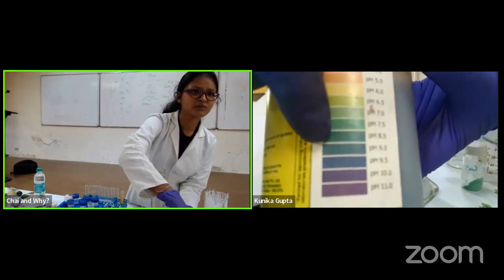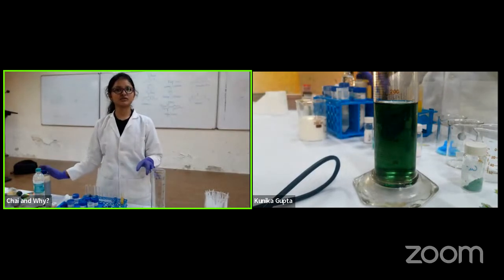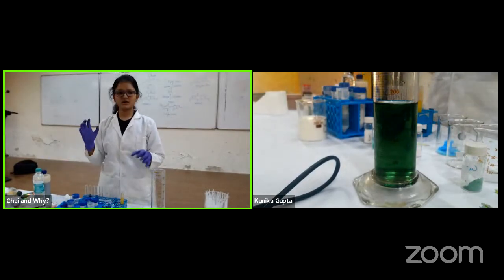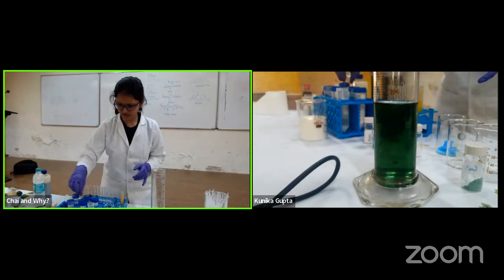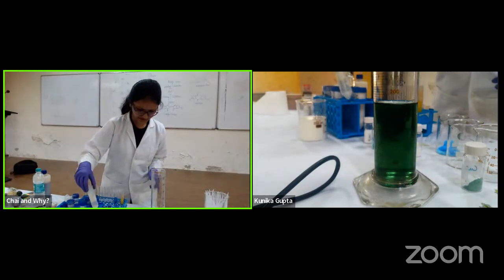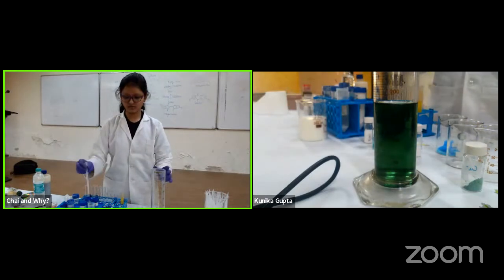Okay, in this range. Now what I'll do is I'll add dry ice to this. Now what is dry ice? You want to first make it more alkaline? I think it's fine. Or you want? Okay. Put a drop of sodium hydroxide. Okay, I can add a bit of sodium hydroxide just to show you that this thing will change the color.